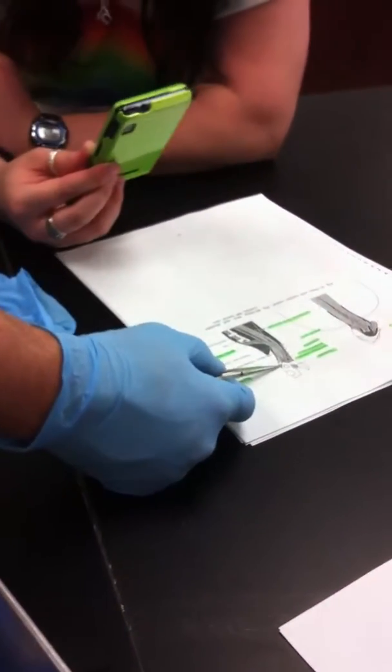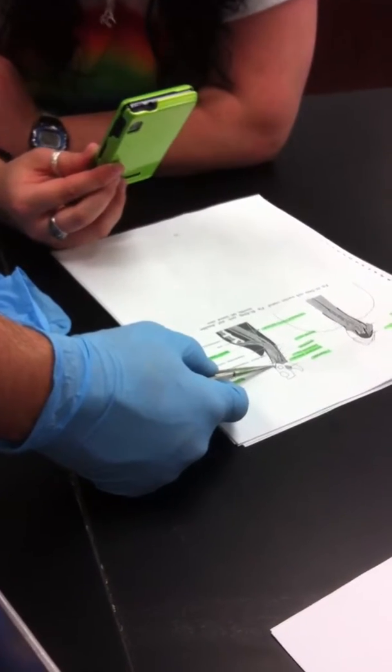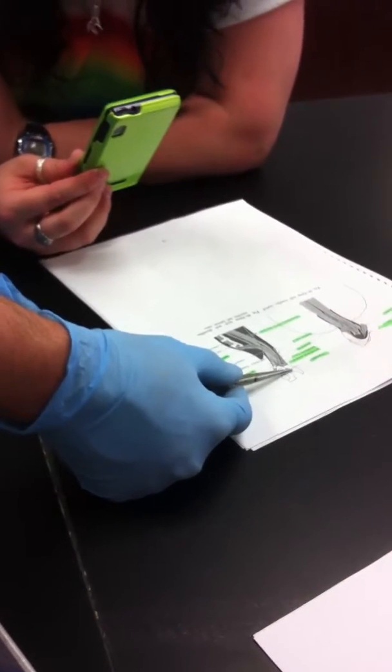You're also going to look on top to find the temporal muscle. The temporal muscle is on the top of the skull and it goes down and attaches to the lower jaw — that's where the contraction closes the jaw.